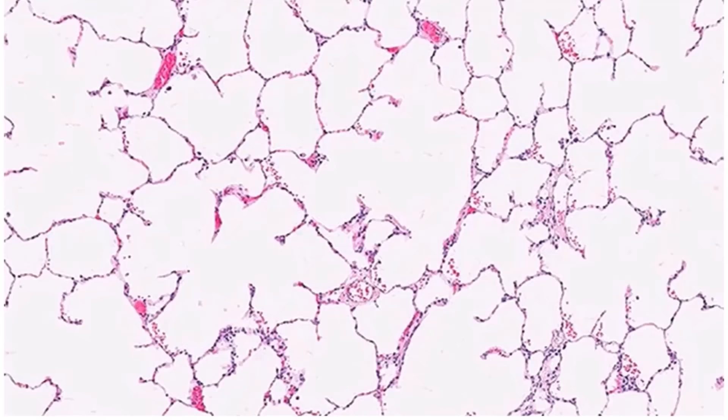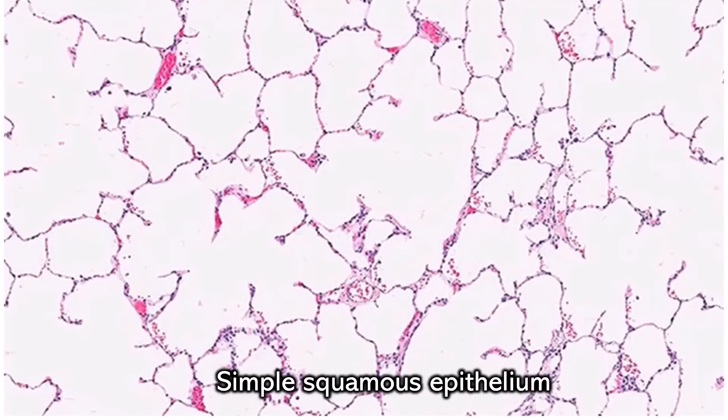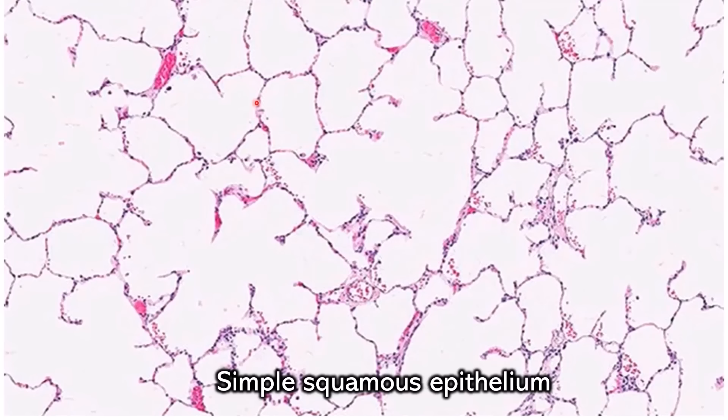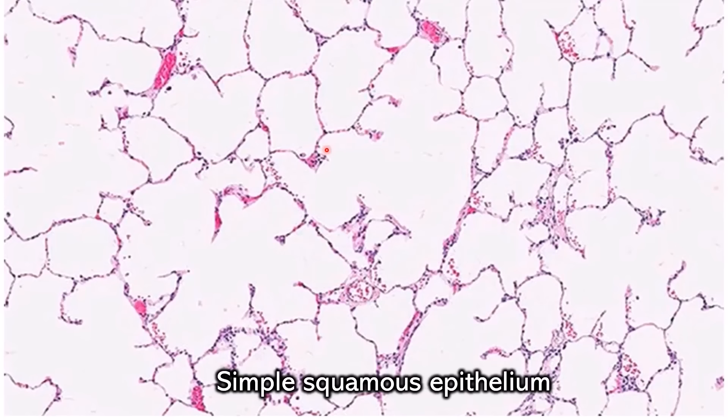I cheated — this is not connective tissue. This is simple squamous. This is how people confuse it with adipose: they see lots of open space and circles and think 'adipose.' But what you need to pay attention to is all those little black specks are nuclei. That tells you that this is multiple cells — it's not just one fat cell. We have multiple nuclei, multiple cells. So this is many little squamous cells making a circle.